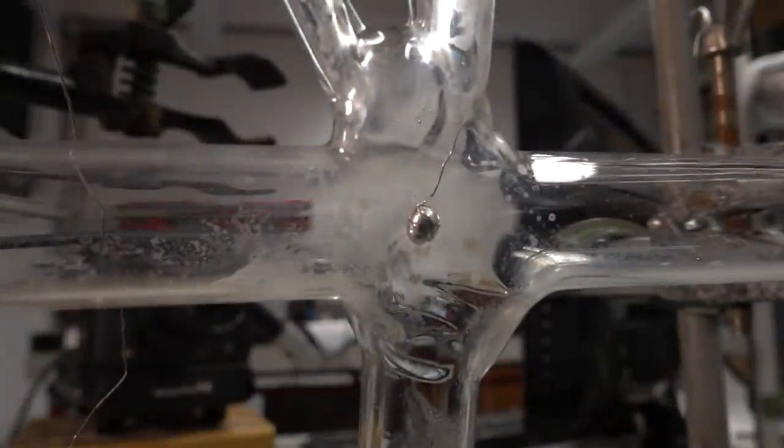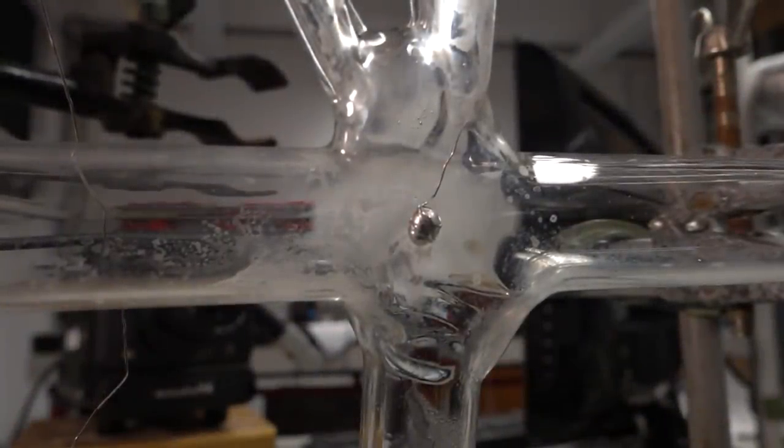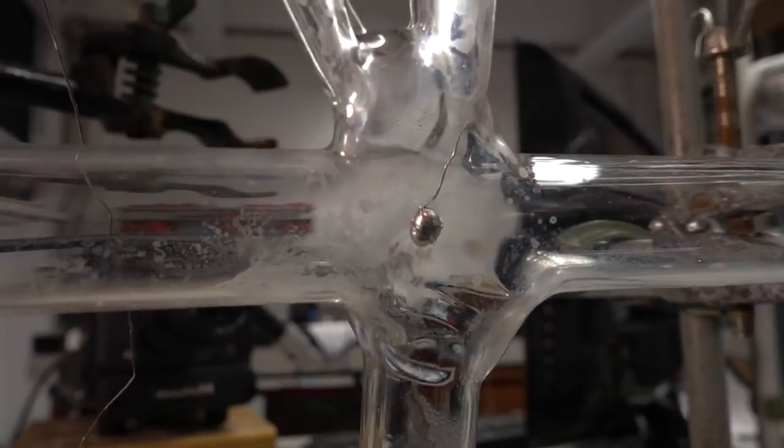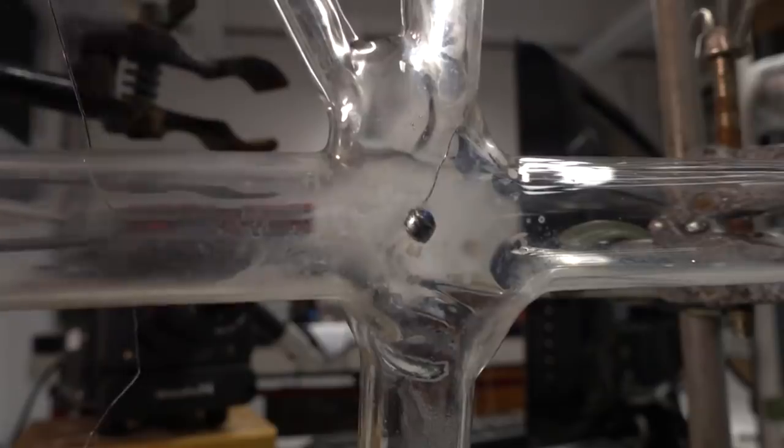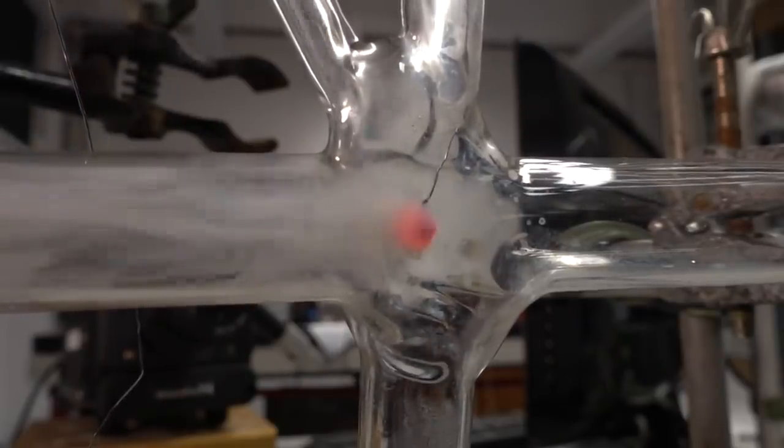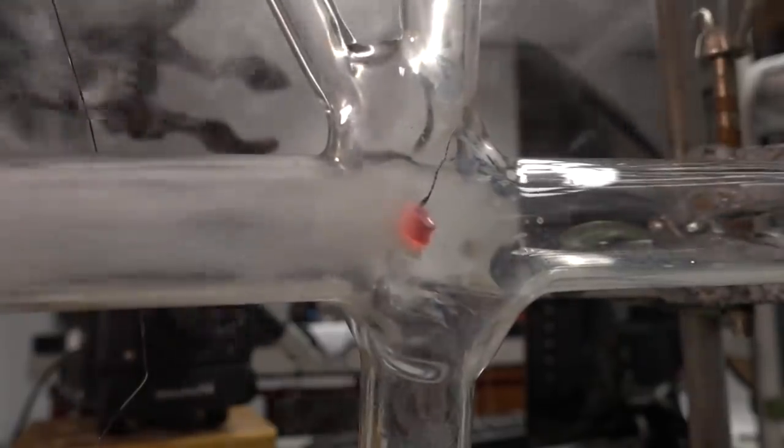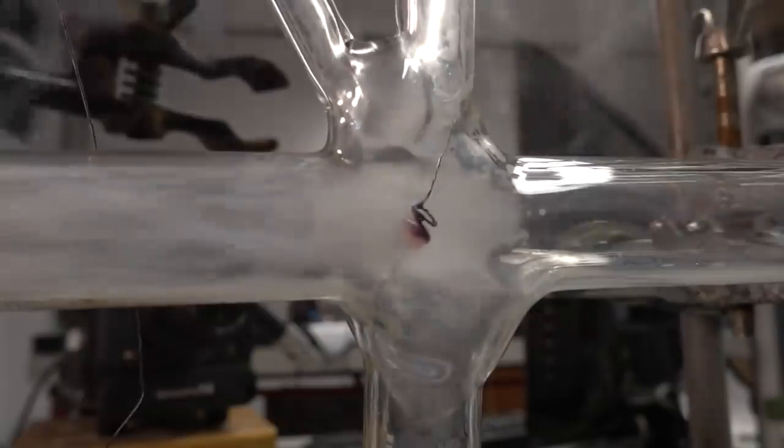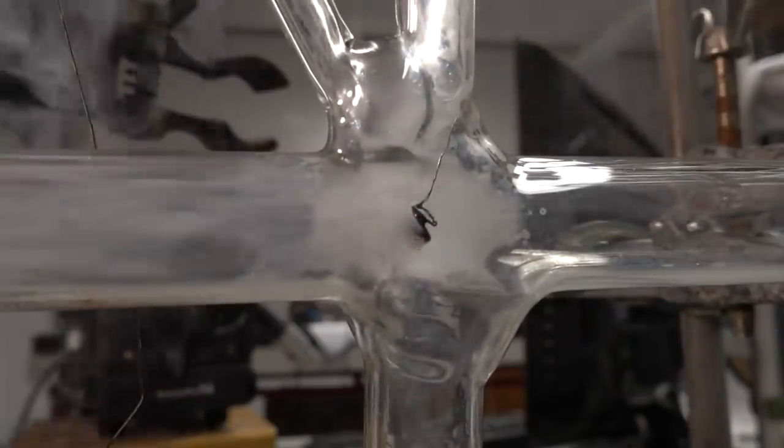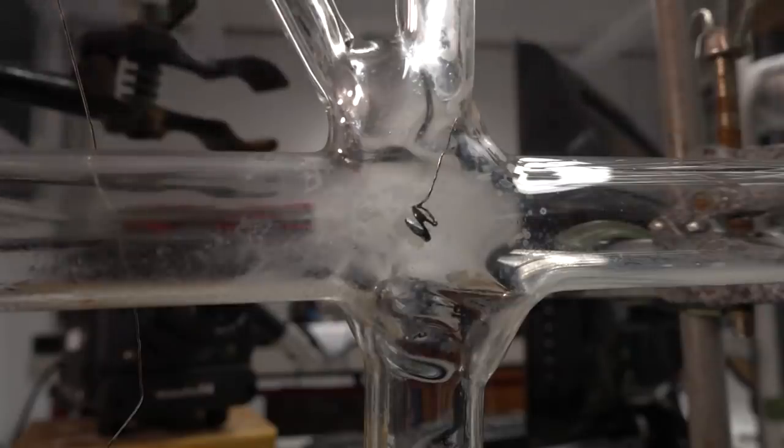Now, at this point, it becomes fairly obvious that the reaction between the alkali metal and the water is mostly a gaseous reaction of the steam with either the liquid or gaseous metal, a point that can be graphically made simply by putting a drop of the alloy suspended on a platinum wire into a steam and argon atmosphere. And there's nothing left! Clearly, in the gas phase reaction, there is enough energy to entirely vaporize this reaction.